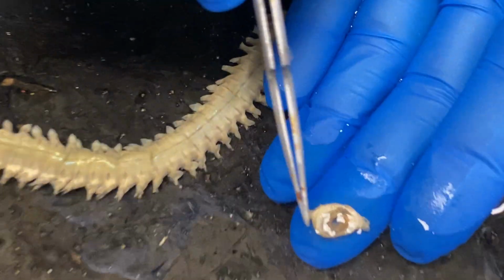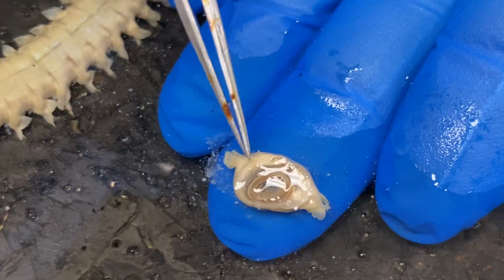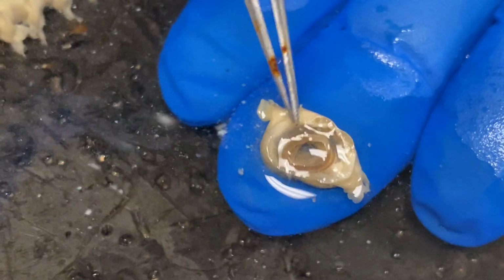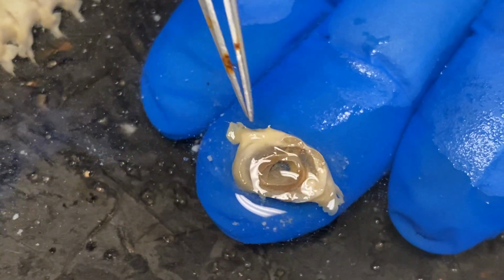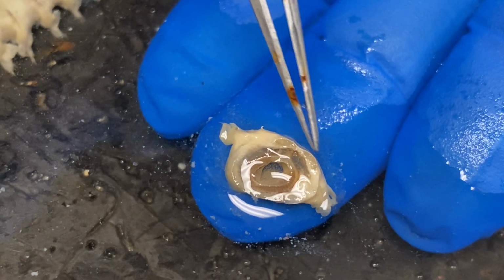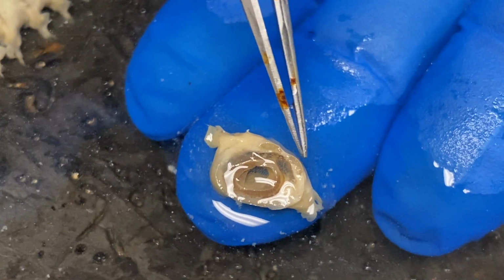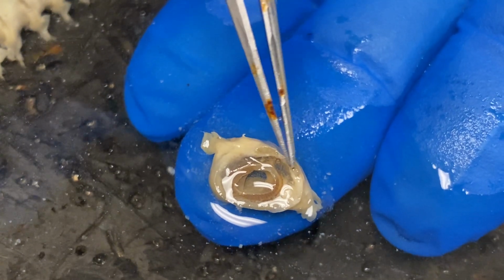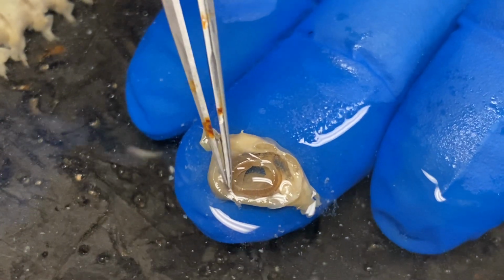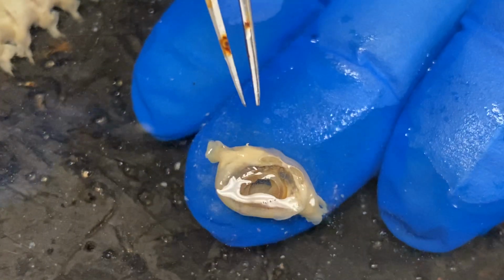So what you can see here, this tube would be the gut or the intestine of the worm. Surrounding that, this space would be the coelom on the outside of the gut. Then we have the body wall, which in annelids has a cuticle on the outside. Here we would have some longitudinal muscles. You can see those packs of longitudinal muscles. Circular muscles span around this body wall, and then we have a parapodium on either side.